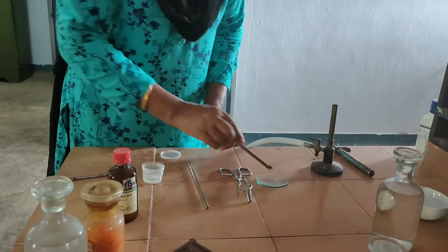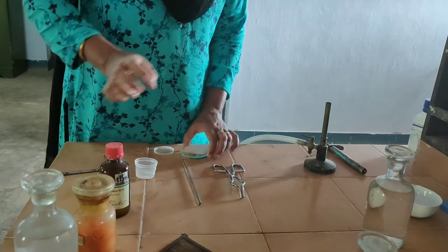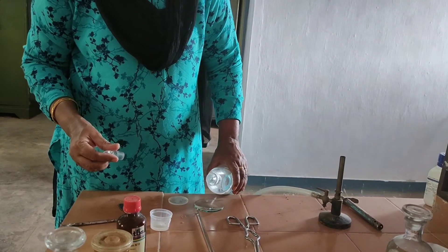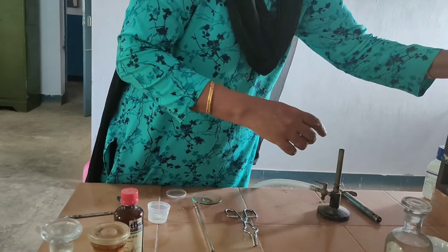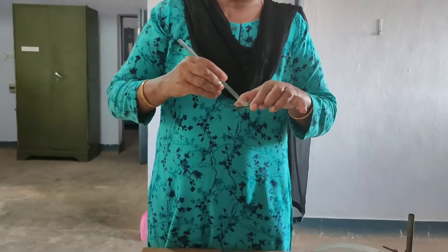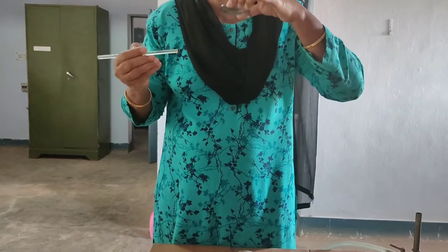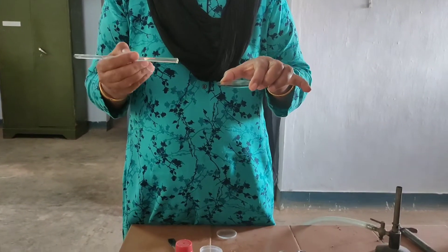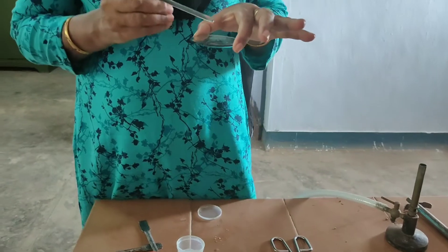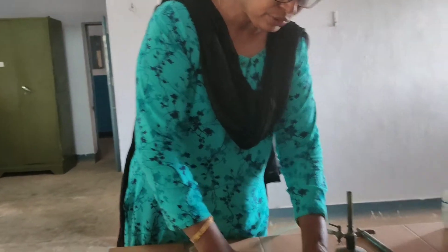Next is the test with dilute sulfuric acid. Take a watch glass, add a little salt, then add a drop of dilute sulfuric acid. Rub it with a glass rod and take a smell. There is no particular smell. If there were a smell of vinegar, it would indicate acetate. Here there is no smell, so acetate is absent.